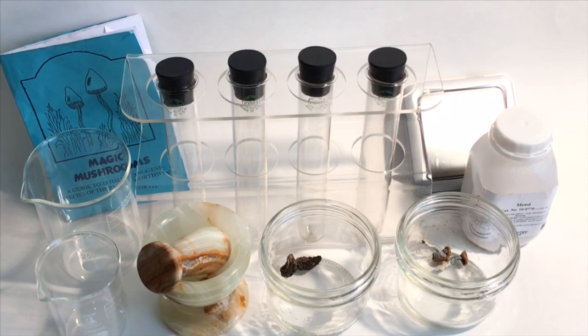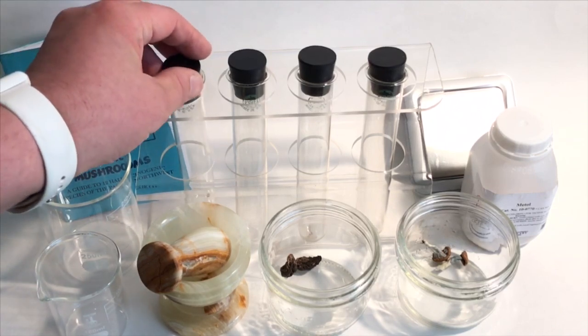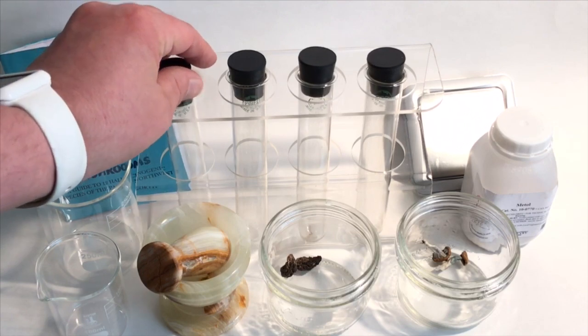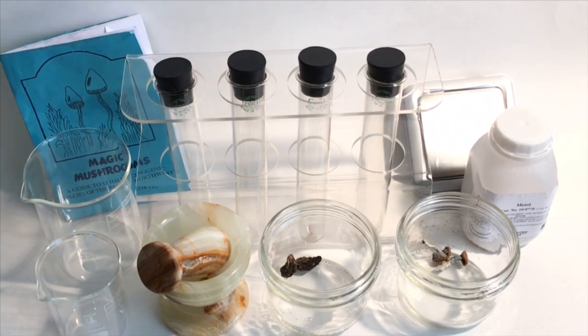I did read what was available mostly on forums and blogs and really there's quite a bit of naysayers and their point is that people should learn mushroom identification. And I guess my point is that I see it as an additional tool for mushroom identification. And if this works, I would be interested in designing a small field test with some smaller test tubes than these and creating a fill line on where to put the water and then carry them on hikes.